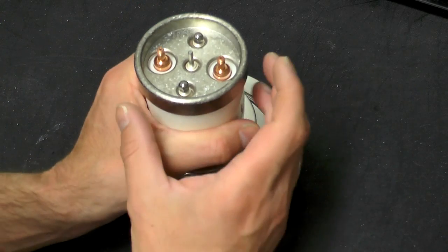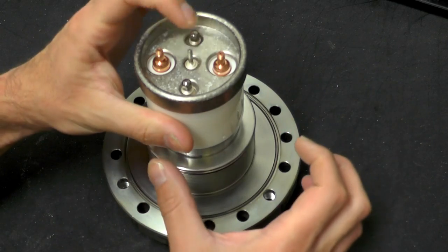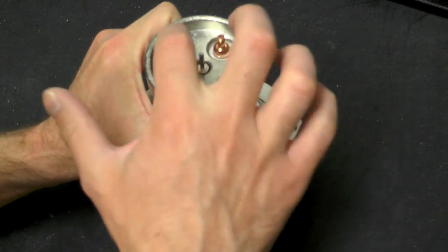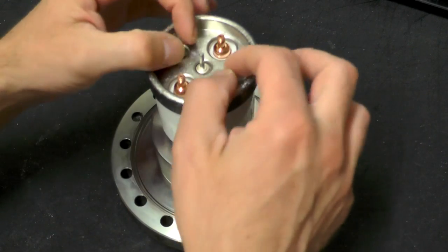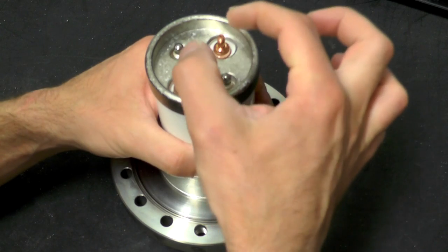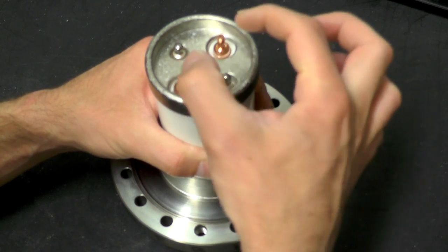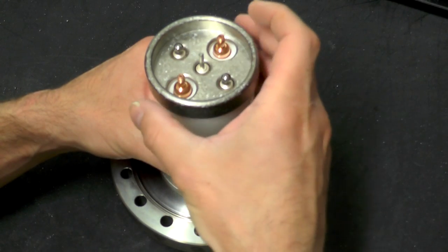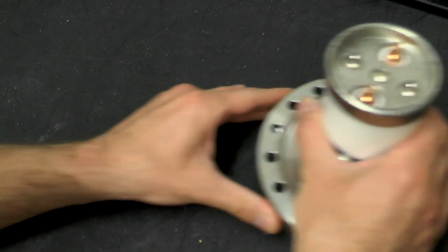The filament is not just a plain wire. On the top we had the connection right up to the filament, and then there was a second connection that also clamped down a piece of metal. We also have two connections here that serve two purposes which I'll go into in a little bit later.